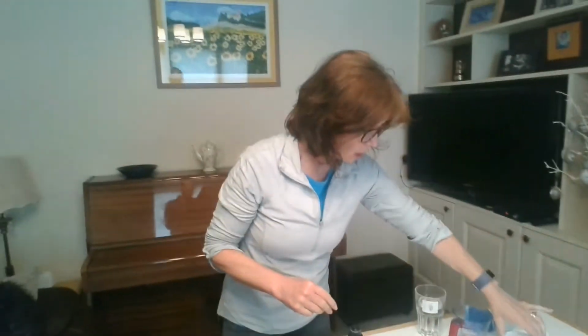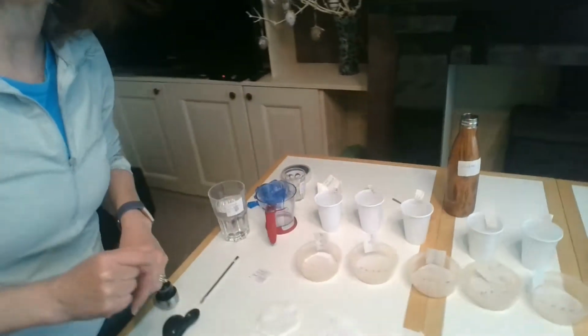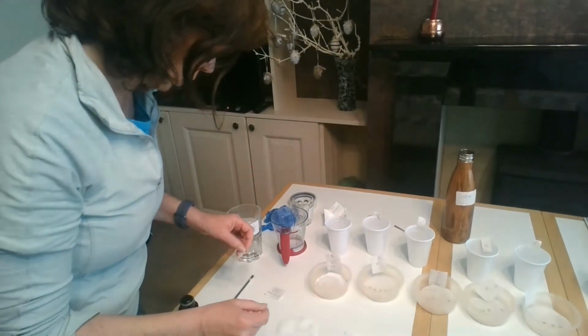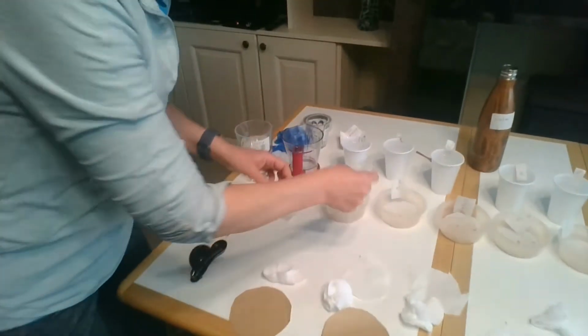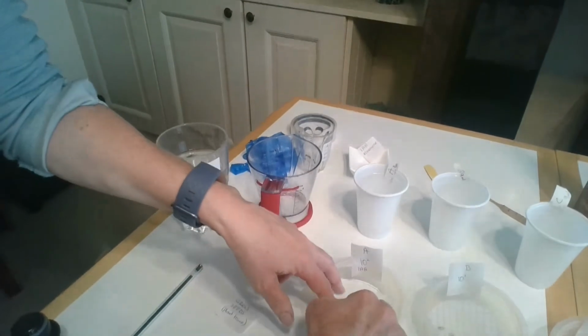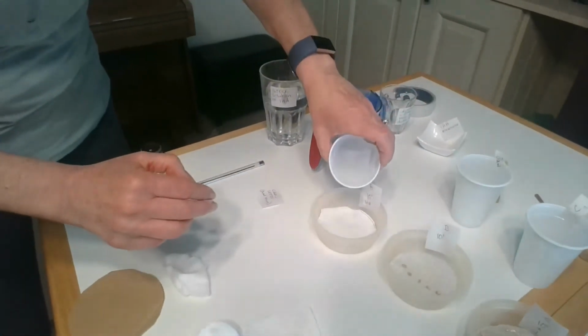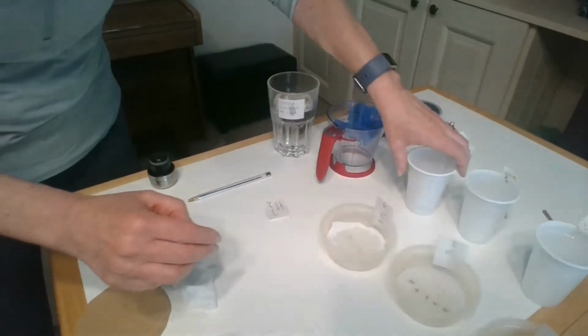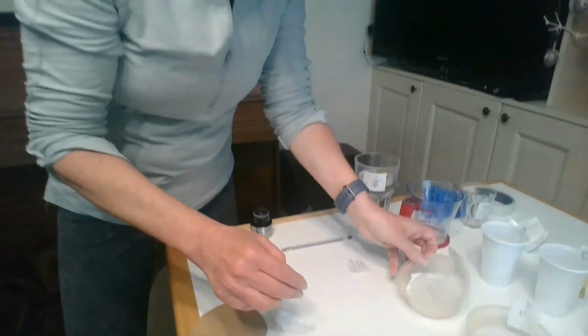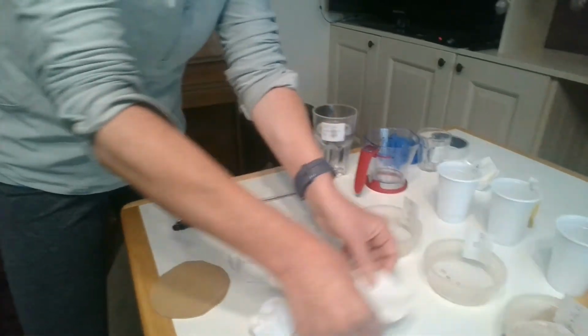So what do we do next? We are now going to add our serial dilutions of the different concentrations of IAA to each Petri dish. So the first thing you do is you put down a small piece of filter paper so that it will cover the bottom of your Petri dish, and you add about half of your IAA solution. Okay, perfect, so that it is wet. The filter paper keeps the seeds in place. That might be a question that they ask you.